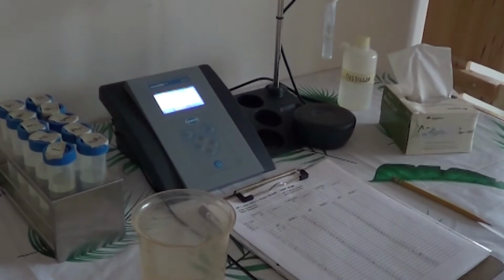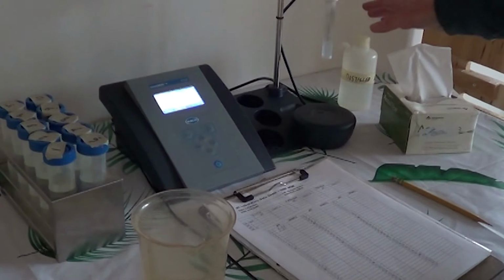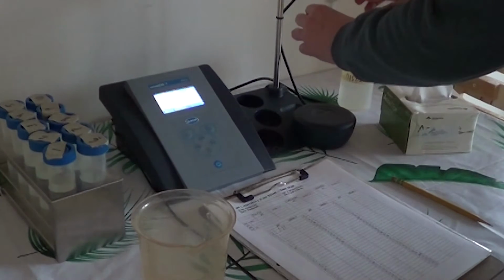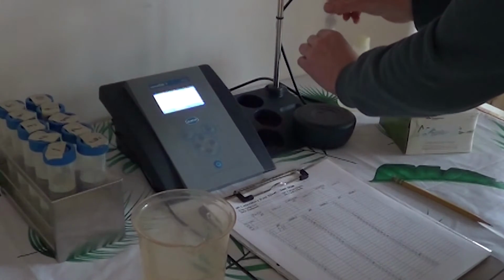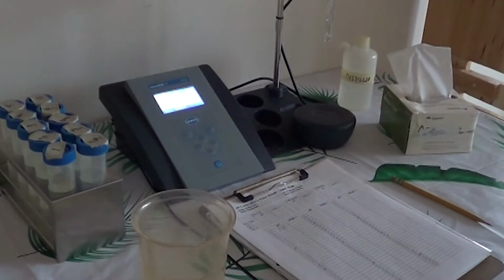Okay, pH. A couple of important things to mention up front when you first get to this station. There will be this little sleeve that goes over the top of the pH probe. The pH probe needs to stay moist or it will go bad, and they are rather expensive. So when you're ready to start doing your readings, you're just going to turn this in a counterclockwise direction, loosen this lid, and just slide this down off of the probe.